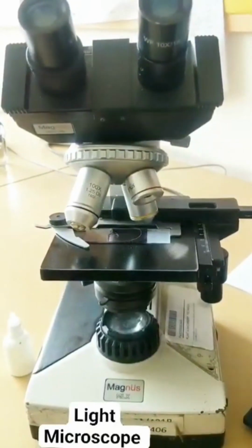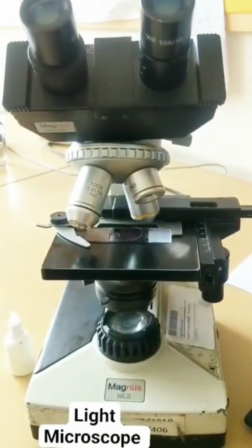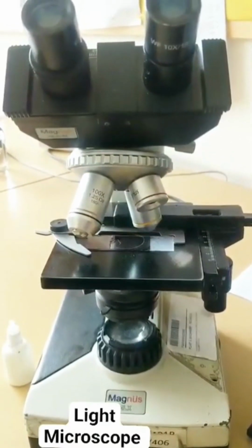Hi everyone, so today quickly let's have a discussion on the parts of a microscope. Early morning, let's finish this small topic.